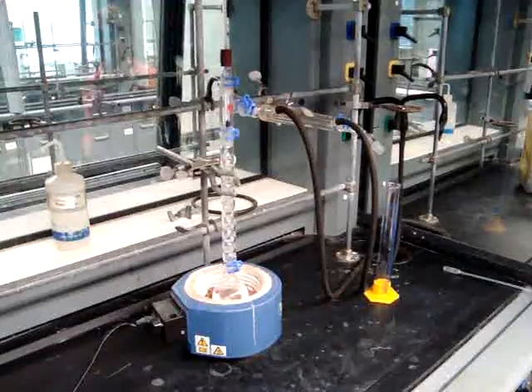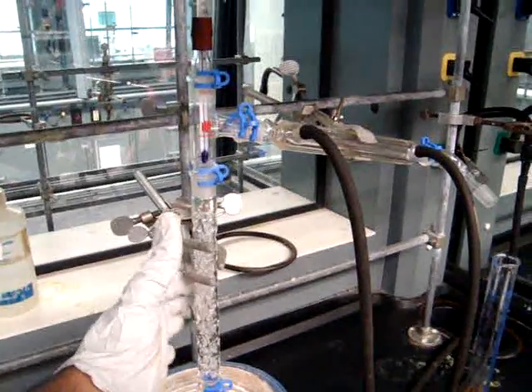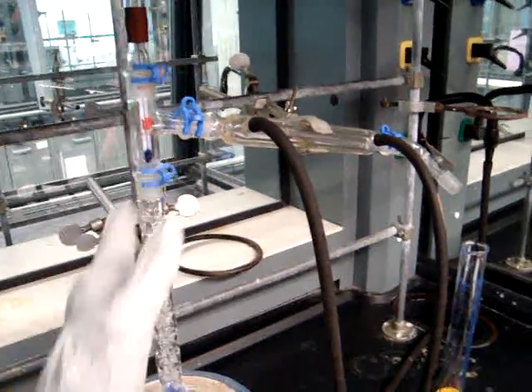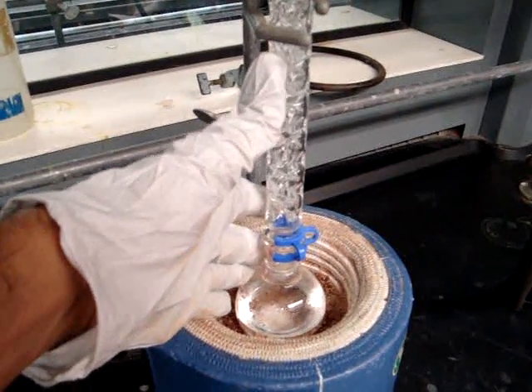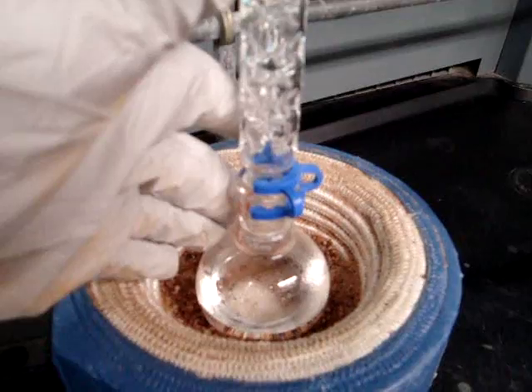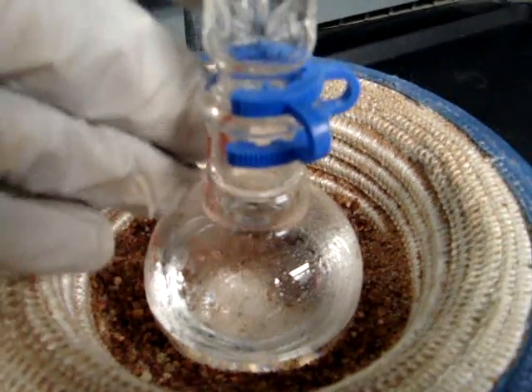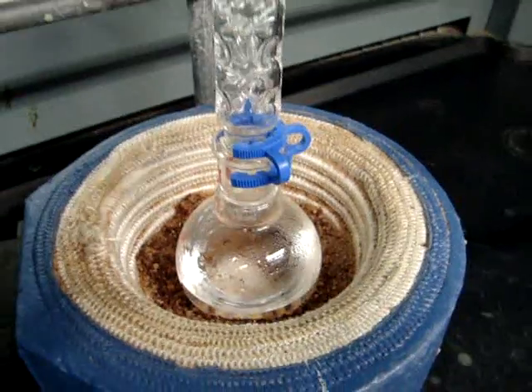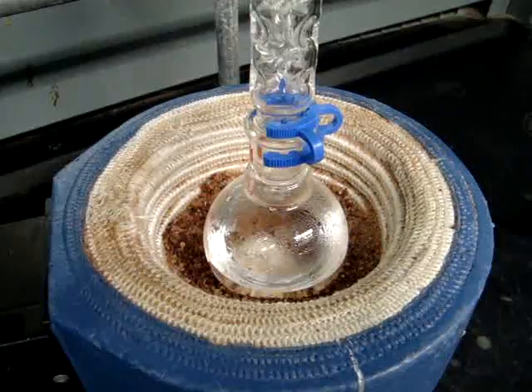This is the setup for a fractional distillation. To set up a simple distillation, all you have to do is remove the fractionating column. We have a fractionating column attached to a 100 milliliter round bottom flask, to which we will be adding 25 milliliters of cyclohexane and 25 milliliters of toluene, plus boiling chips. The round bottom flask sits in a heater with sand in it.